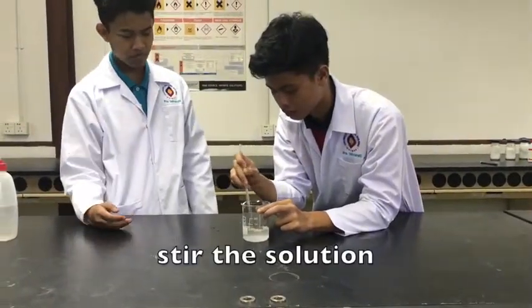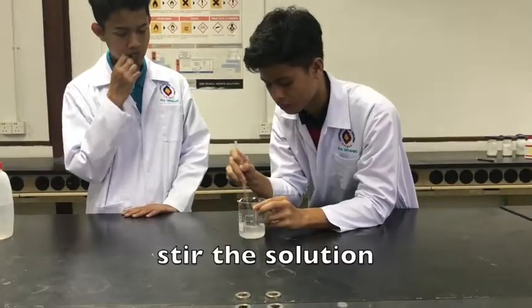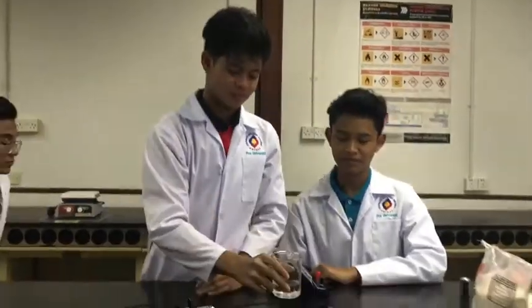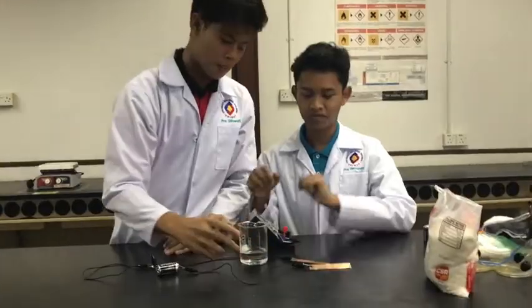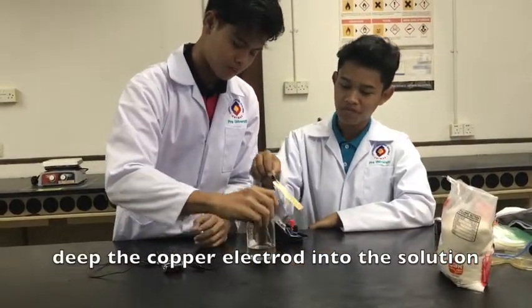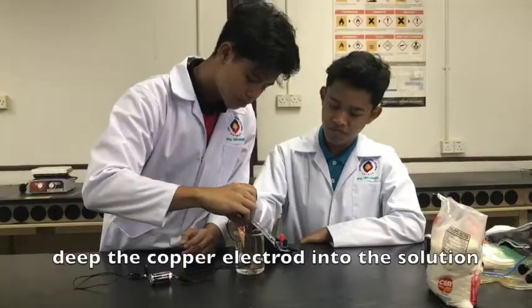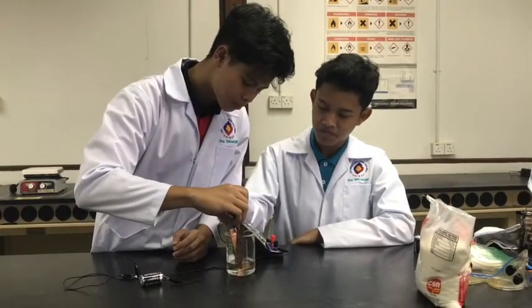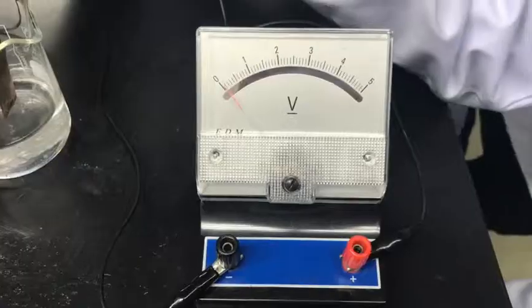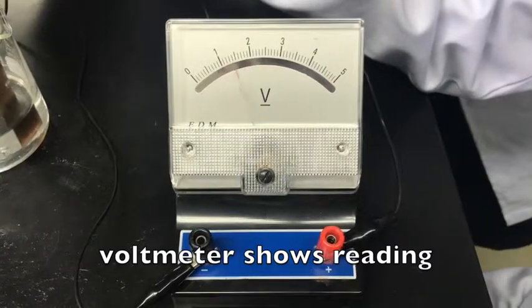Stir the solution until the sodium chloride is fully dissolved. Next, dip the copper electrode into the solution. The voltmeter shows a reading.